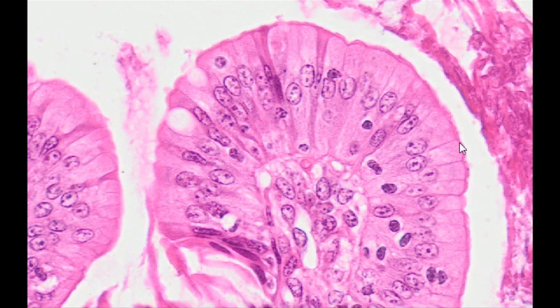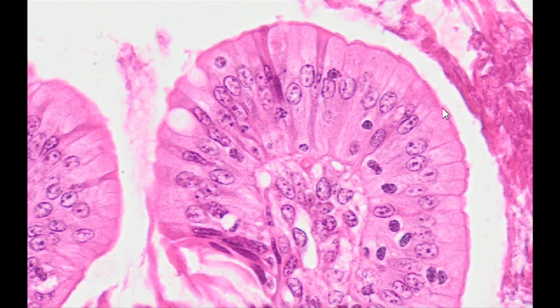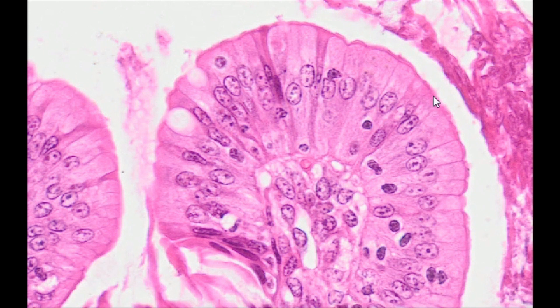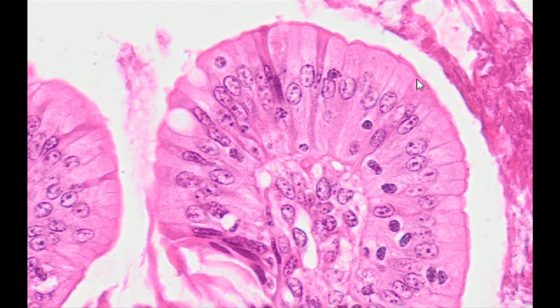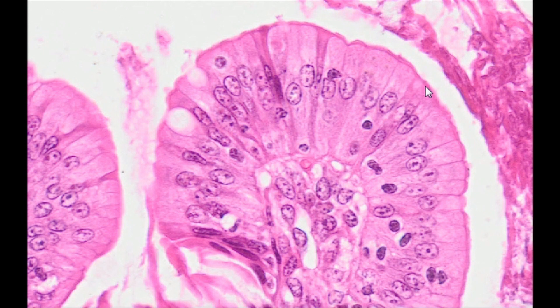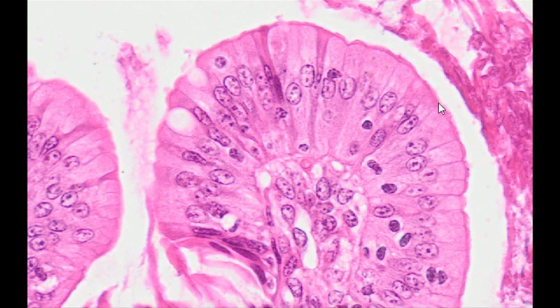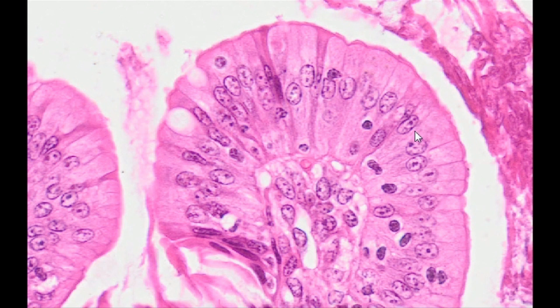The specimen shows simple columnar epithelium lining small bowel mucosa. Due to the functions performed in this organ, the cellular composition of the epithelium is quite diverse. The following cell populations are found in this epithelium.